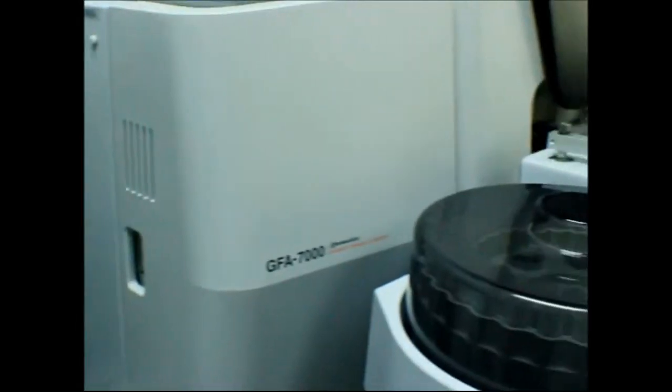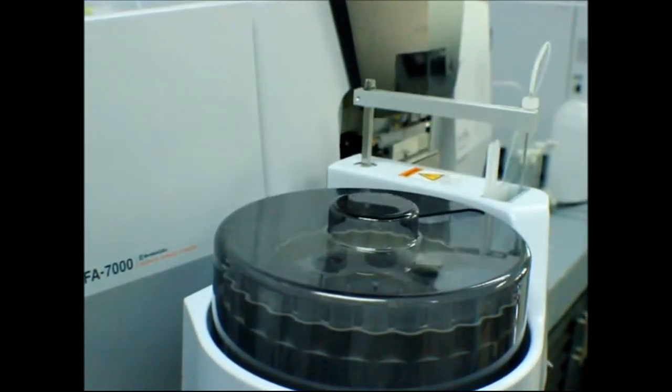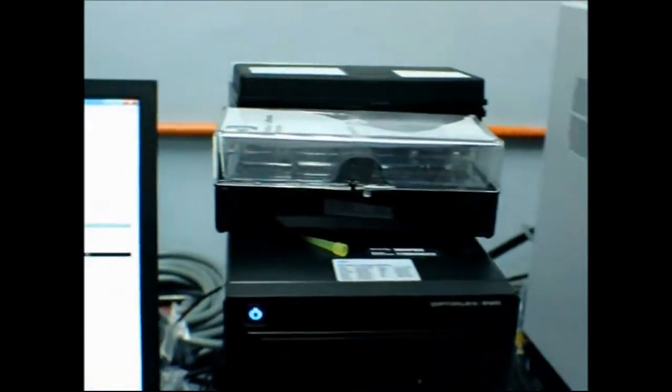Then they will run your first standard. So you don't have this one, so we better delete first. Cannot delete here. How to... cannot delete, okay, so I stop first. Pause. After this I'll stop. Then later you put your sample inside. Don't give blank because there's nothing here.